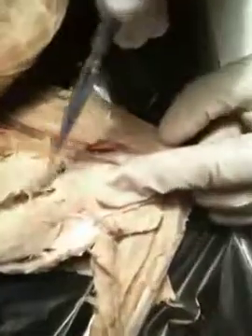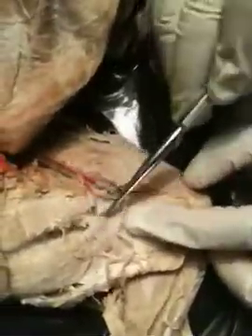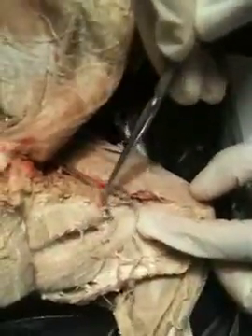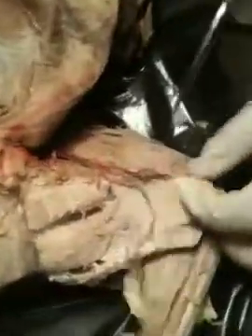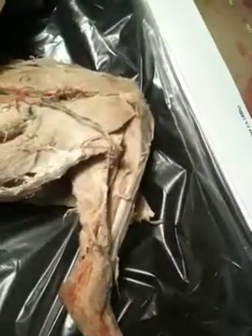I don't even know where that is. Maybe this one? If I'm not mistaken, it's right here. Yeah, that's the deep femoral vein. So this is the femoral, and then that's the deep femoral. And then the femoral turns into the saphenous. So it'd be somewhere over here. I believe the saphenous is not even on there. But we know that this is the saphenous from here, and then from there it turns into the other ones. Okay, that's it.